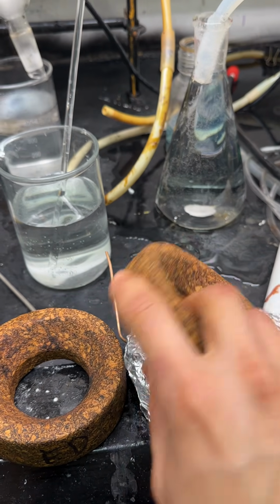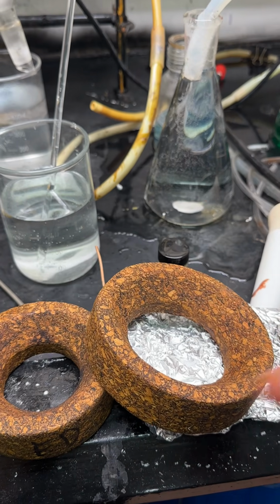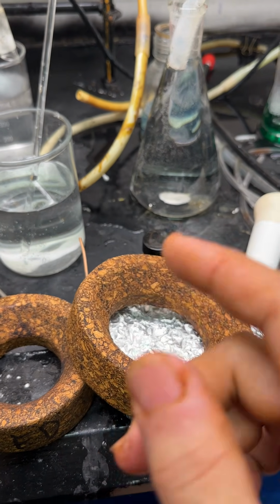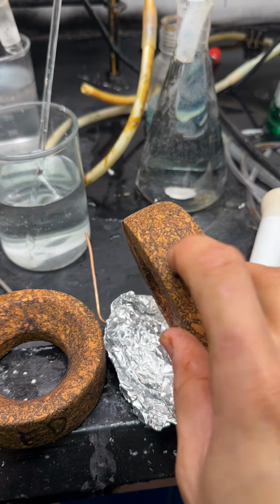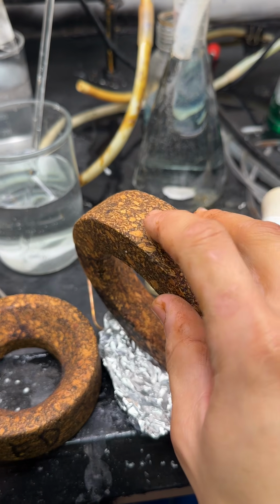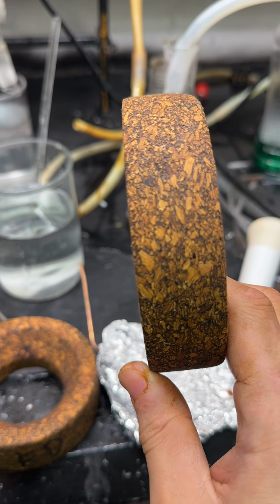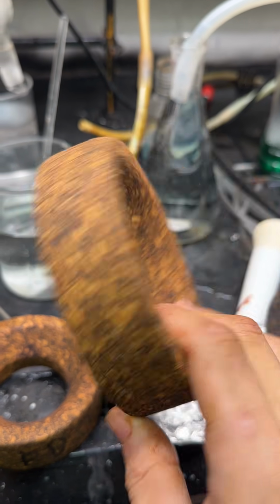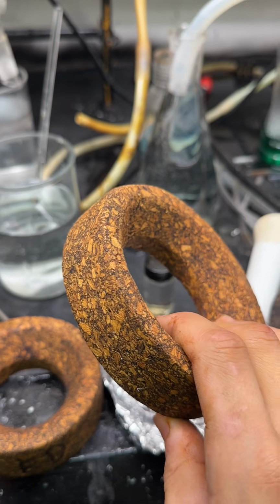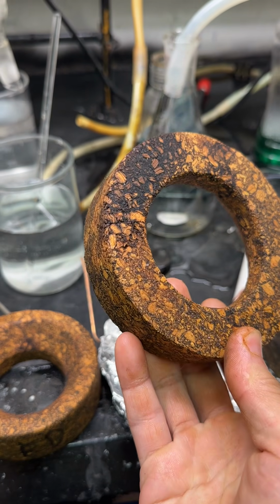But then the problem is that the outside is, of course, greasy. So what I did is I took some linseed oil and I boiled it with cobalt acetate in a pot outside on a hot plate until it started fuming vigorously, and I rubbed that brown, oily, tarry mixture all over this to give it a coat of polymer. So I just realized I just made linoleum cork rings, because linoleum is made by boiling linseed oil with a catalyst like lead or cobalt, and then mixing with sawdust. So I just made linoleum.